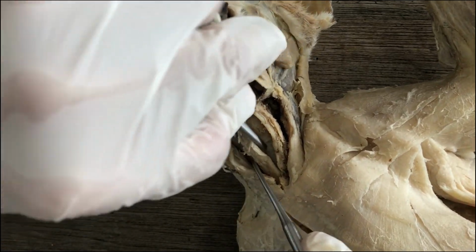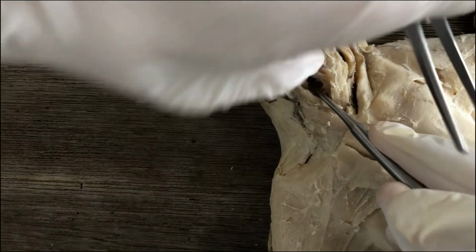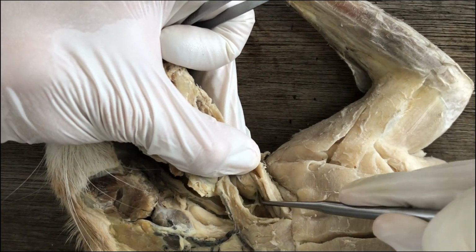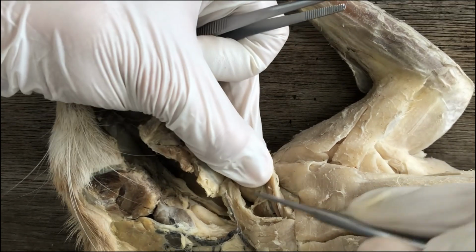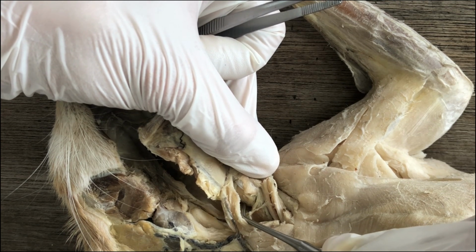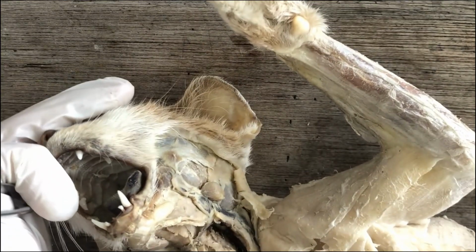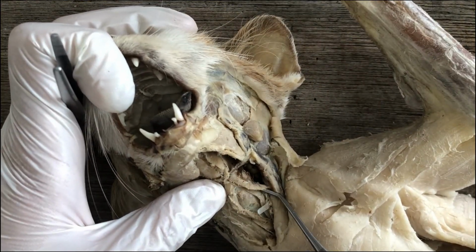If you dissect the larynx really well, you will be able to see there's a cartilage at the back side of the larynx, and it's broad. That's the dorsal portion of the cricoid cartilage. So it's broad at the back, but only thin and ring-shaped ventrally.